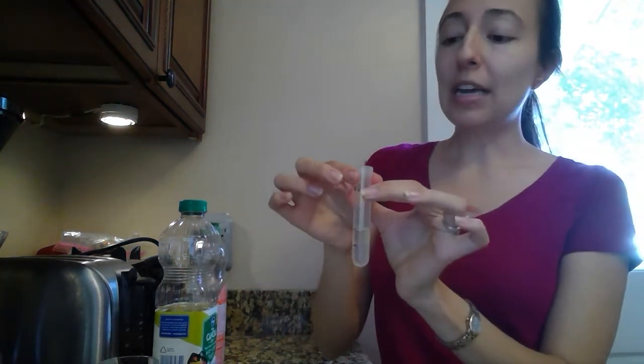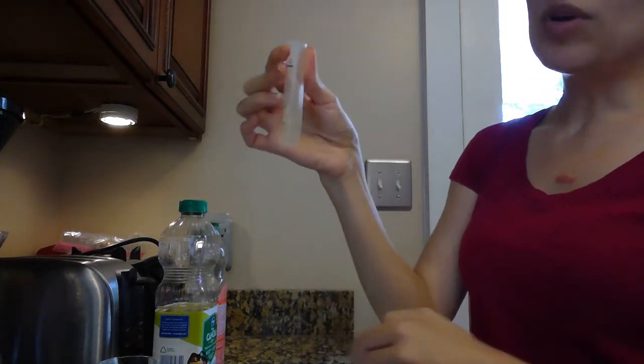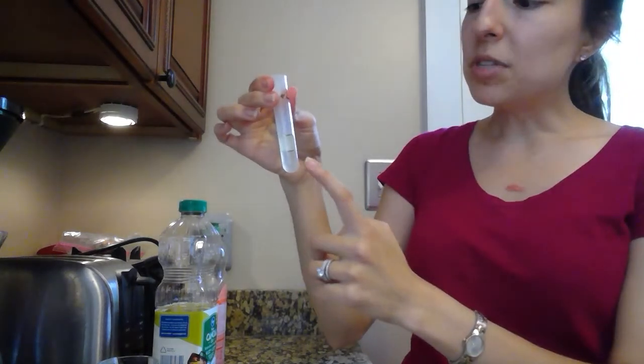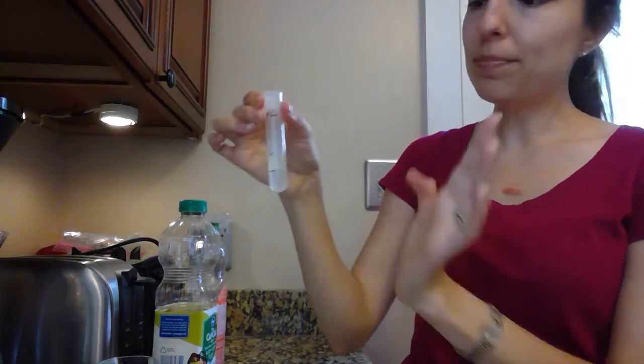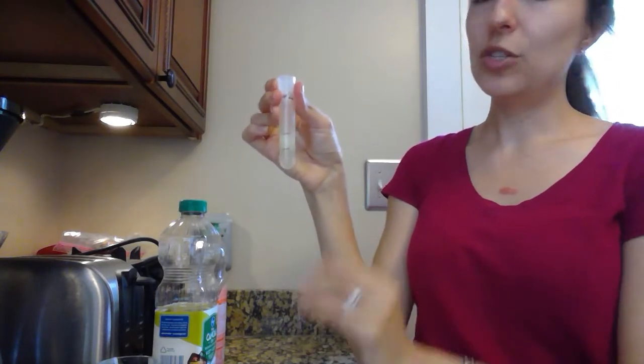So what we do instead is you want to have a nice firm hold on the top part of the test tube. And then you take your other hand and you really just kind of flick like that. You want to do it a few times. We call this the finger push method or the finger flick method. It actually helps to stir up the solution from the bottom. You can't really overmix this too much right now. So play around with it.